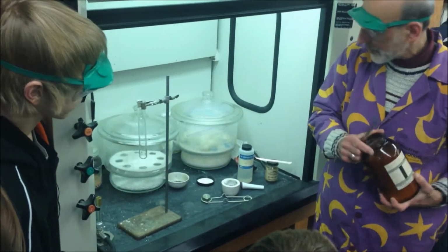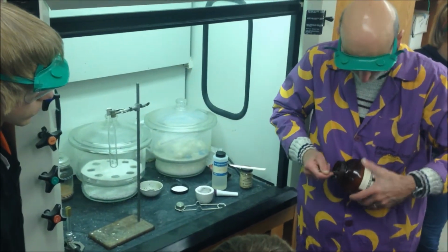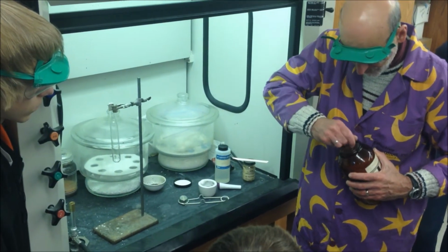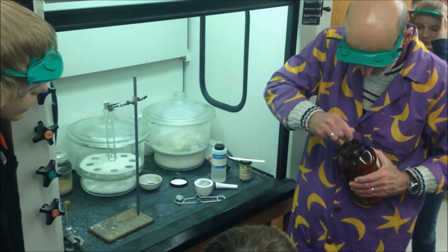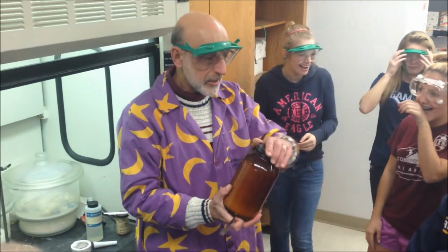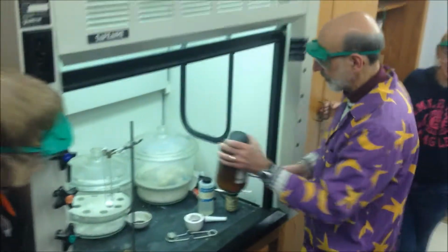Just like the potassium permanganate. So what I'm going to do is put a bunch of this stuff in, a little bit of chunky powder. KClO3, again, percentage-wise, it's got a lot of oxygen. A lot of materials have a lot of oxygen stored in them.